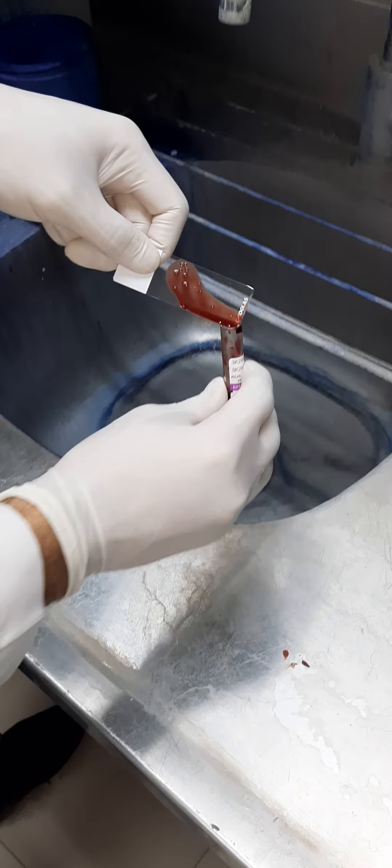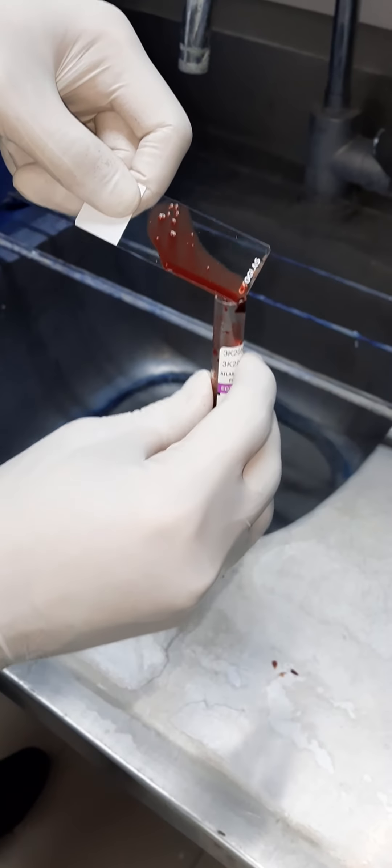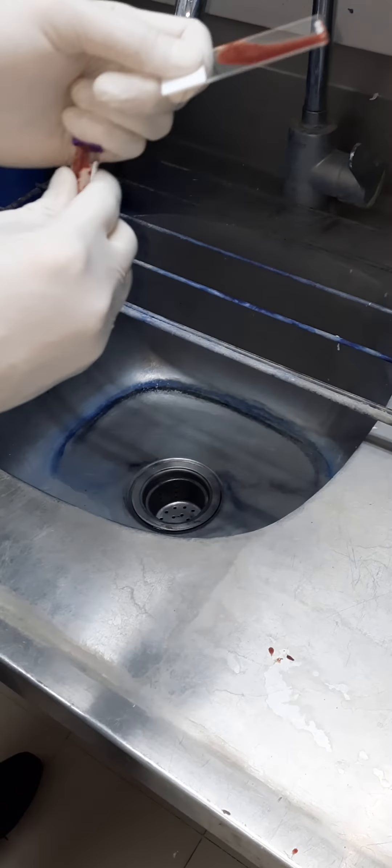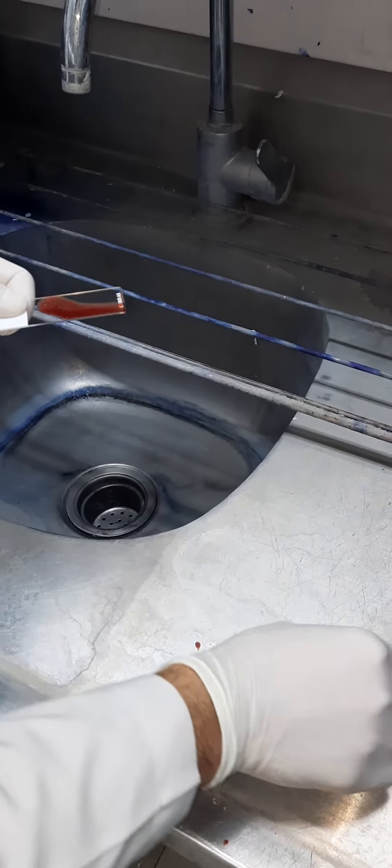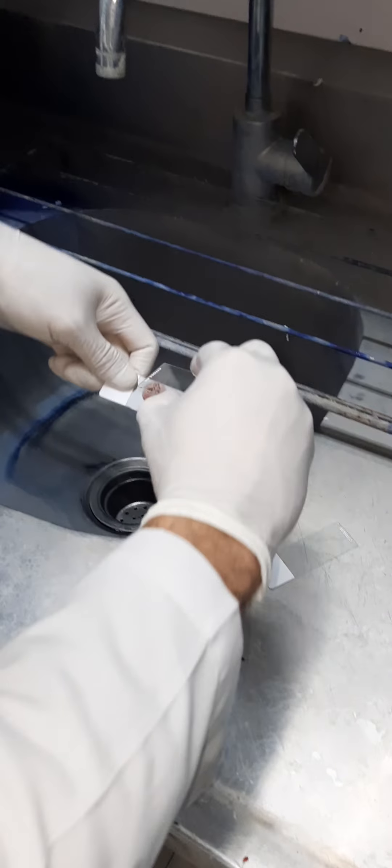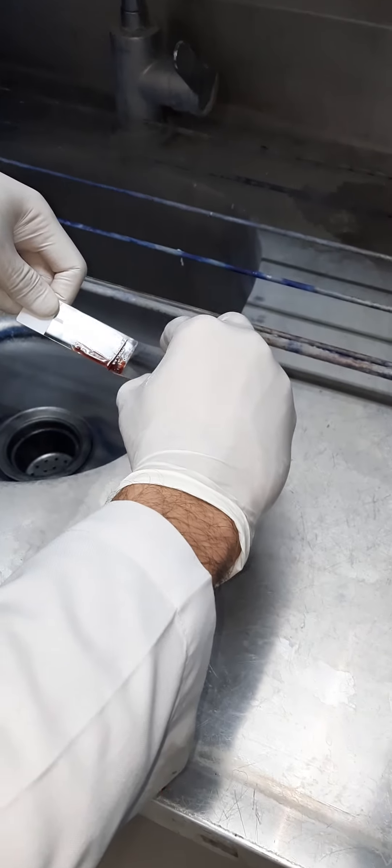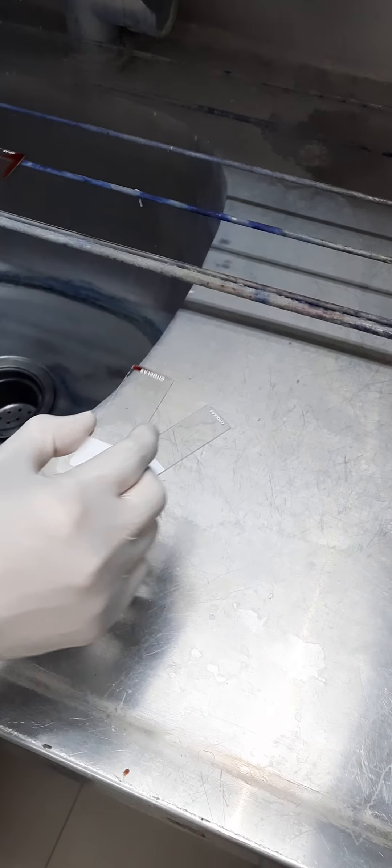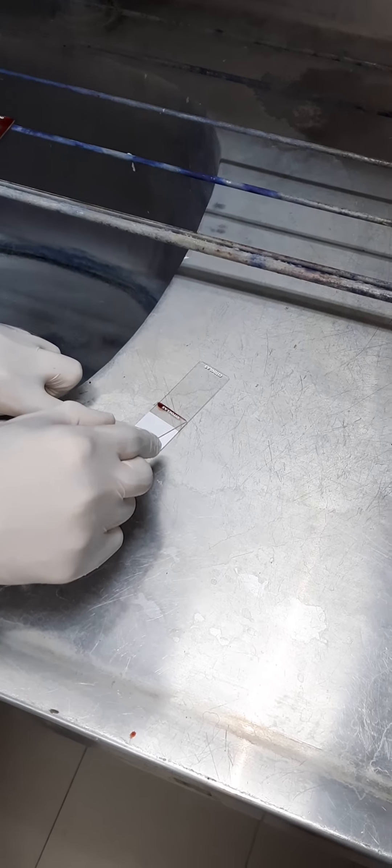You can see that there are a lot of particles in here. We have to then smear these particles on the slides like this. We have to transfer the particles, then we have to smear it on another new slide.